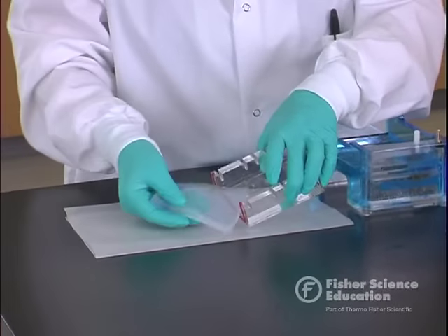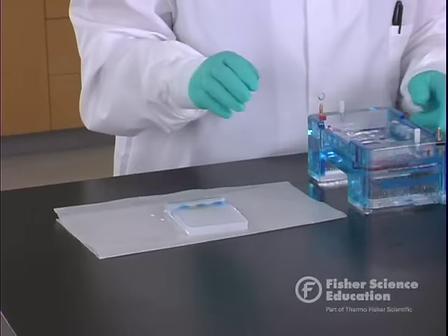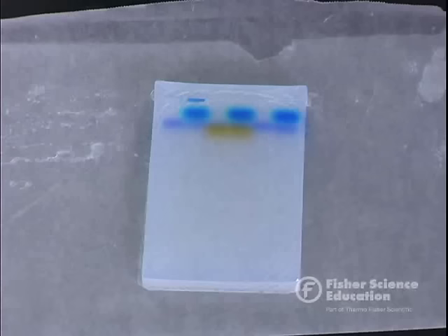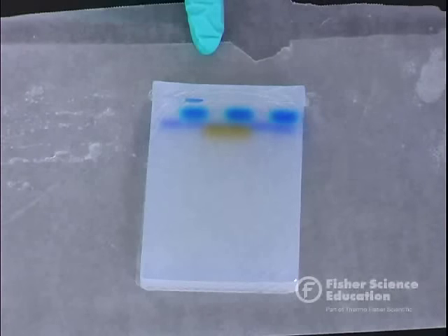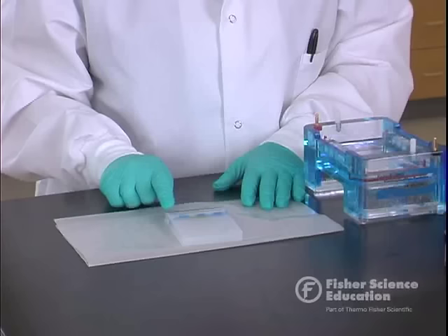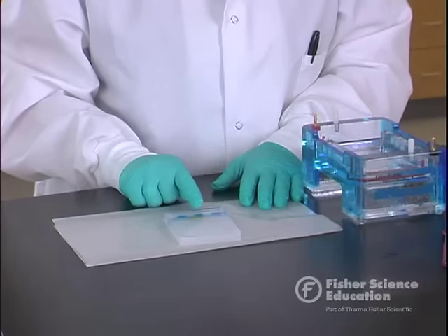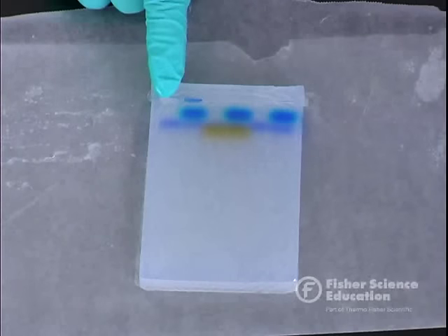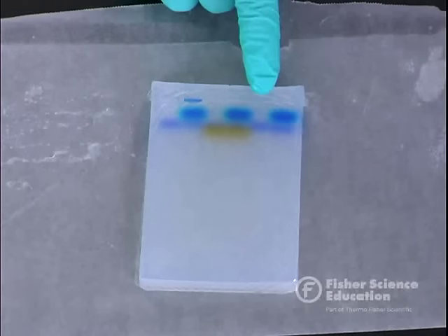The gel slides right out of the tray. You can place it on wax paper, in a weigh boat, or on a white styrofoam plate — anything that will allow students to visualize the dyes. This first lane can be compared to all the rest. In this example, these are all the suspects, and this sixth one is the crime scene. You can see two bands here, a single band, three bands, two bands, two bands, and one band. This allows students to look at a sample collected from a crime scene and compare various suspects to it.